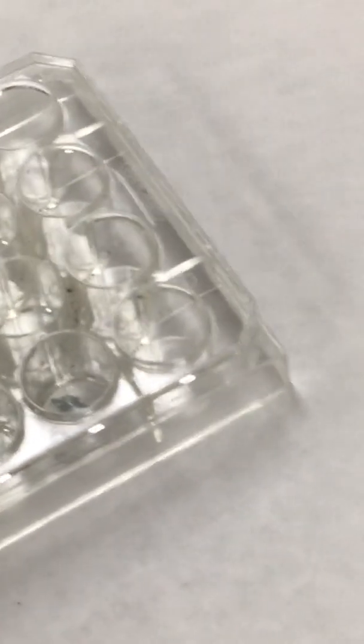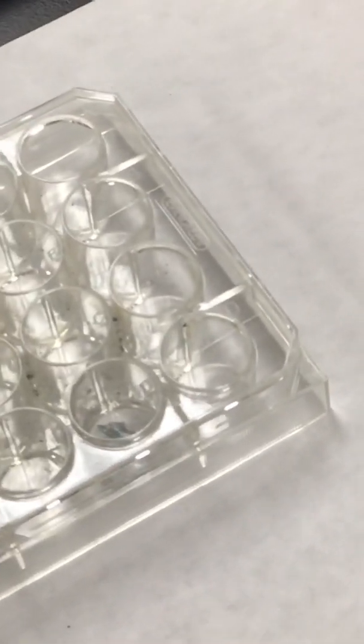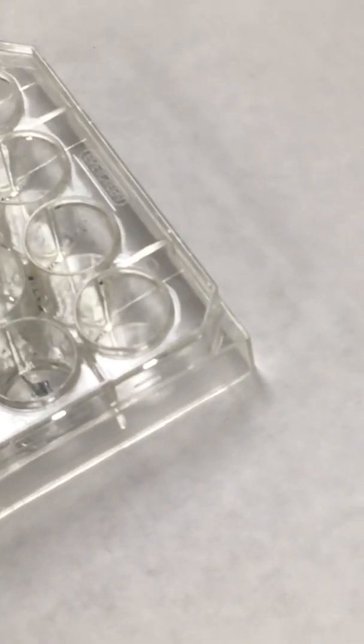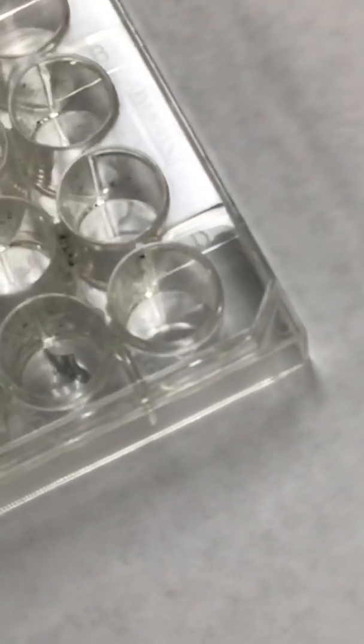It's very hard, guys, but if you take a look in the lower left quadrant, you can see some bubbles coming. Yeah, there's some bubbles. See, it's starting to bubble. There's a little bit of bubbling. Yep. Okay. It's down there in the lower edge. Oh, yeah, I can get over the top there, and you can see the bubbles. Yep. On the edge. Awesome.